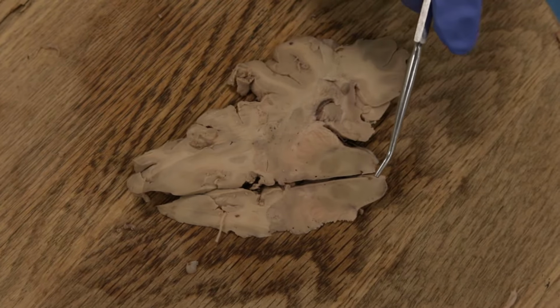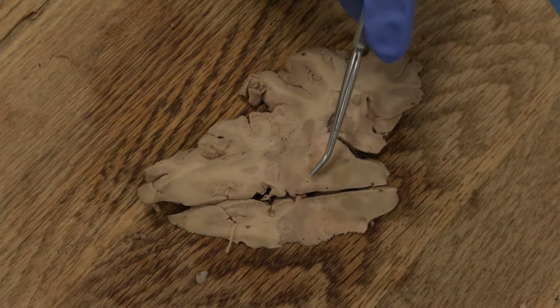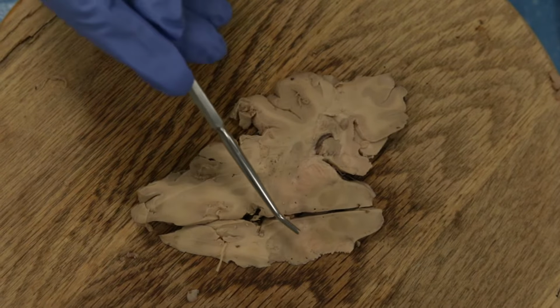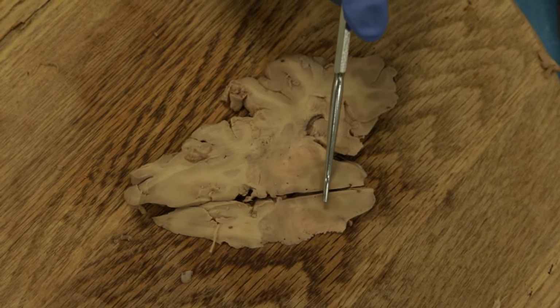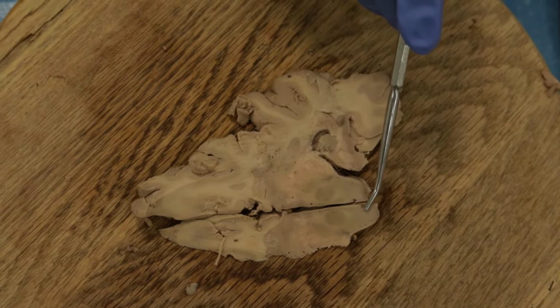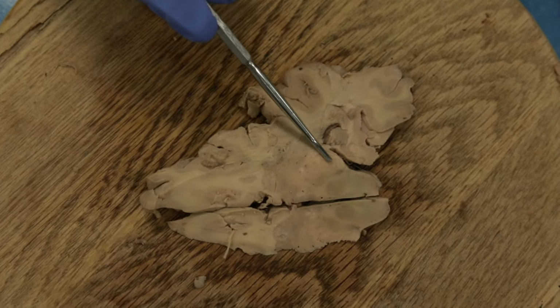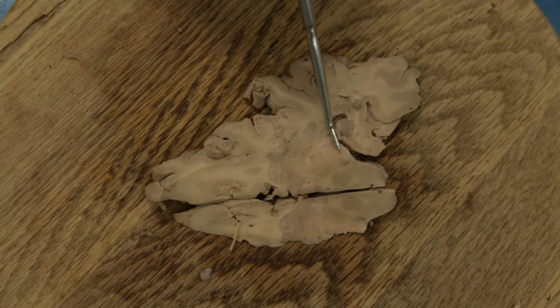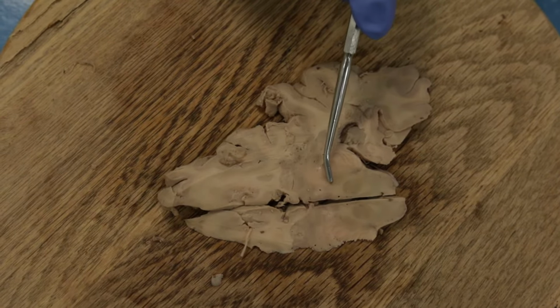All right, so the most important thing here is that now we're just a little bit lower, and very clearly now this is midbrain. So the midbrain, remember, has the cerebral peduncles out here. Okay, the tegmentum, which is this whole portion here, and then the tectum back here, which is the superior and inferior colliculus. So let's start here from the cerebral peduncle. Okay, again, has all these striations here. Okay, and now the subthalamic nucleus is really large, so you can see it right there.